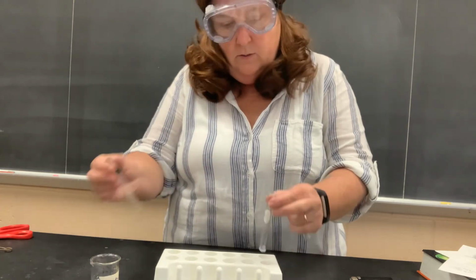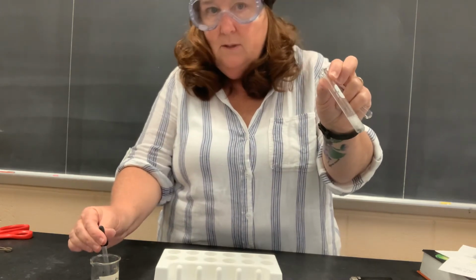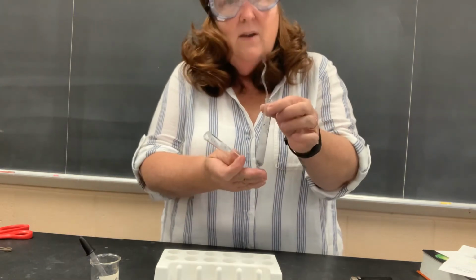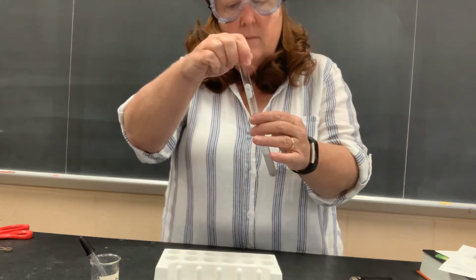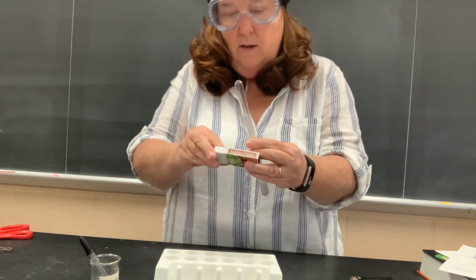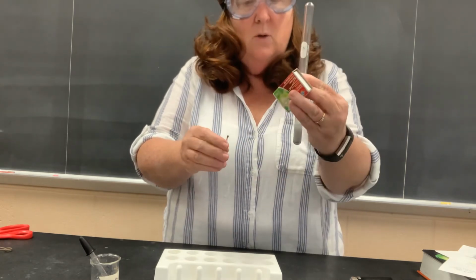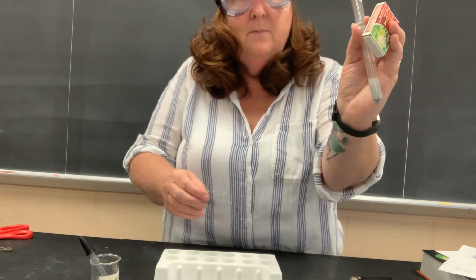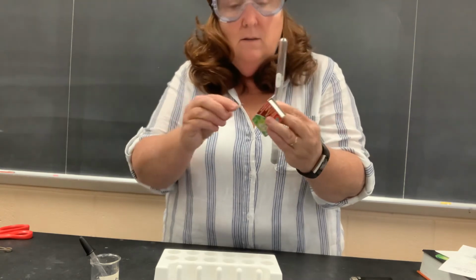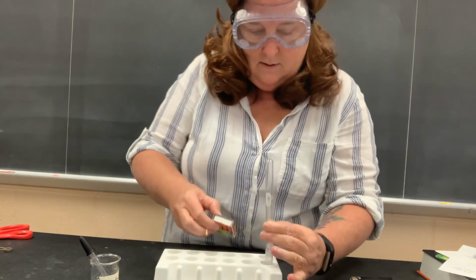Very strong hydrochloric acid. You can see, I don't know if you can see or not, there are bubbles. See the bubbles forming? There's a gas given off. It's getting very warm. I didn't think this through with the match, but I'm going to try. I'm trapping as much gas as I can. You can still see the bubbles forming. That's how you can tell it's a chemical change. So acid reactivity, that's a chemical property. It's getting very hot now. I'm going to set it back down.